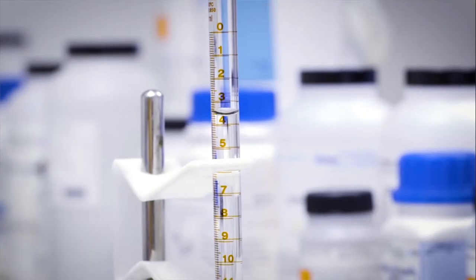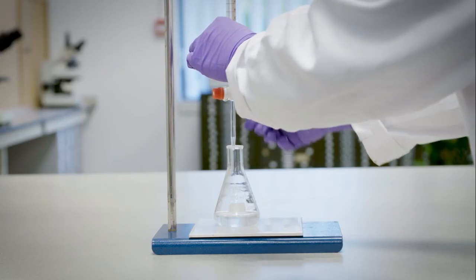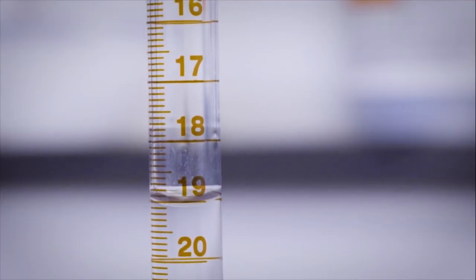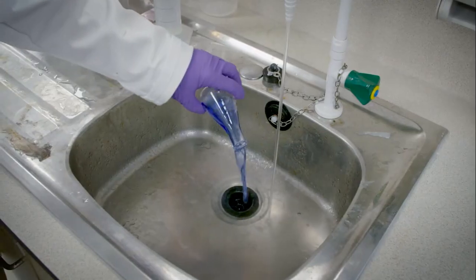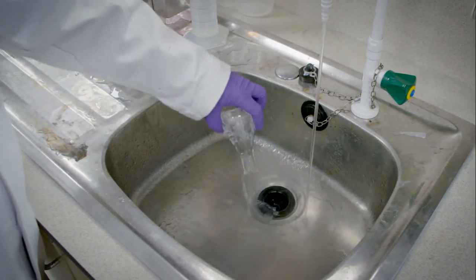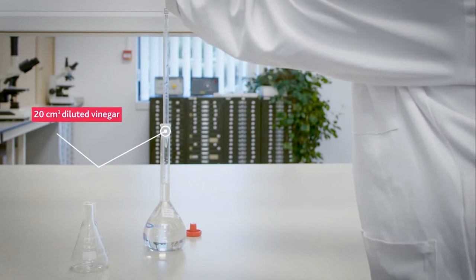The sodium hydroxide is added to the conical flask 1 centimetre cubed at a time. The conical flask is gently swirled between additions until a permanent blue colour appears. At the end point, no more sodium hydroxide is added. The contents of the conical flask are poured down the sink and the flask is washed out with deionized water. Next, an accurate titer will be performed.